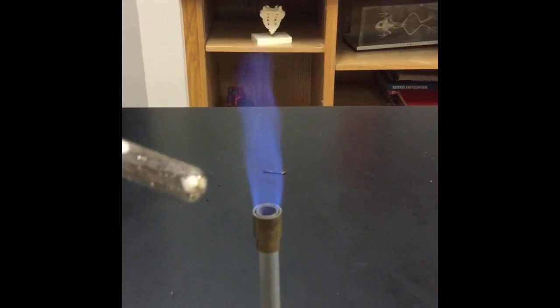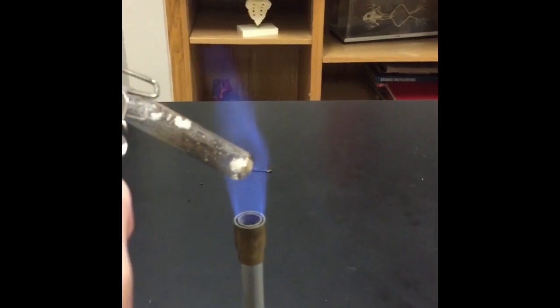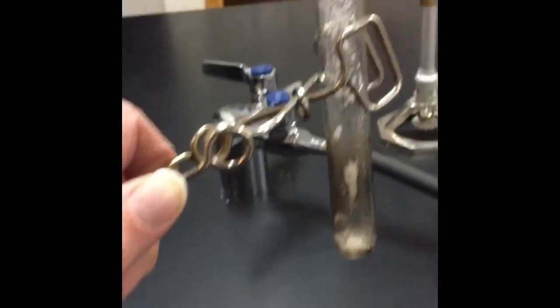Okay, this is the reaction on lab station 3. This is lab reaction 3. So what I've done is placed a small amount of ammonium carbonate in a test tube. Now if you look carefully, there's a liquid forming there. So you guys can see the liquid as it forms. Okay, let me just turn off the gas. Okay, so the liquid is forming there.